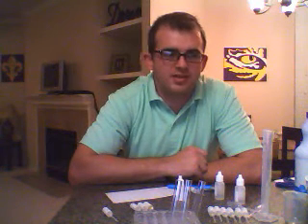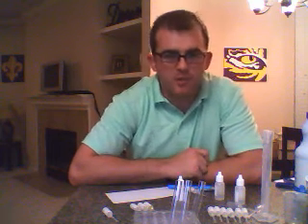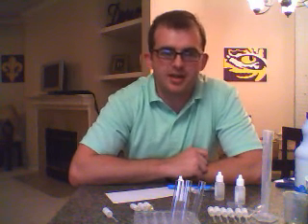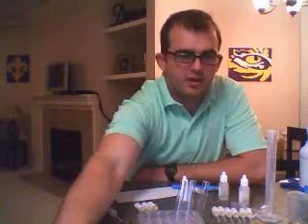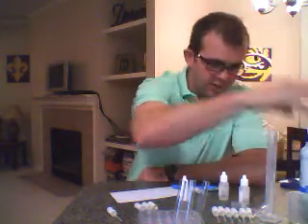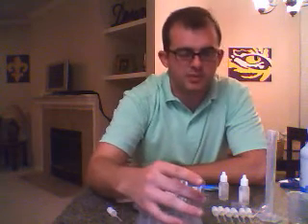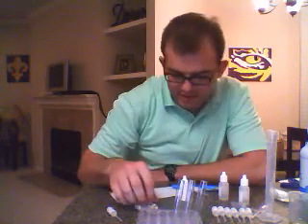This is Jonathan Wallace doing Gen Chem 2 lab number 4, qualitative anion tests. And you can see we've got a lot of our materials out here. We have our well plate, our 3 test tubes that we're going to mainly be using. We've got all our anions and our cations.